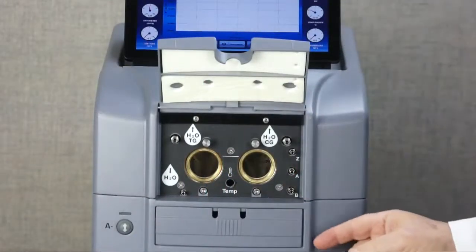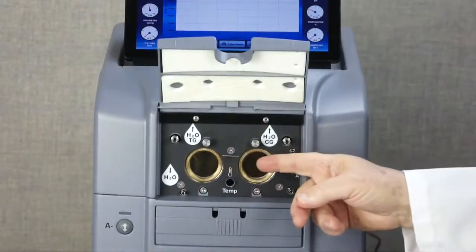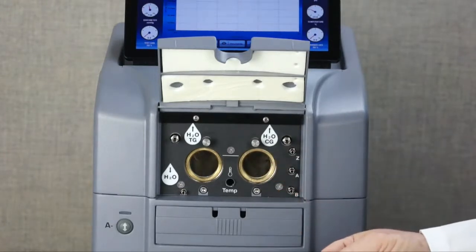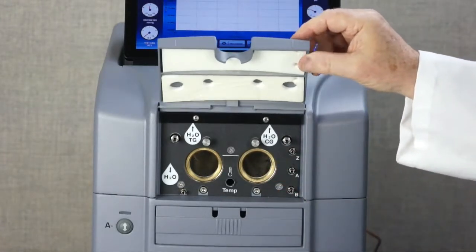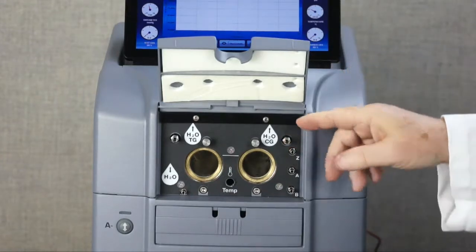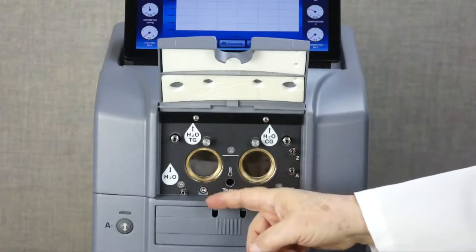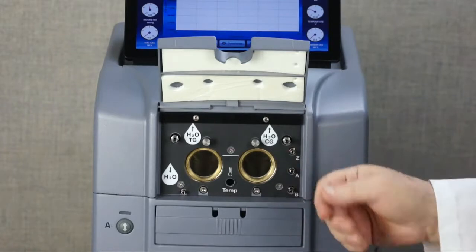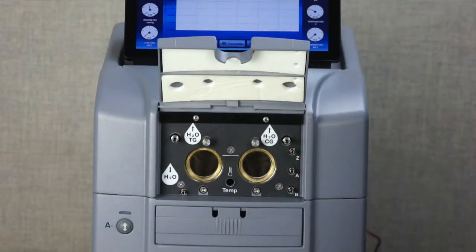We have added almost 4 times the amount of water that can be carried in the reservoir. Adding water is simple. Just lift the cover and inject water through this Luer lock fitting. For transportation, all water is easily removed through this one port. One time-saving feature of the system is that it will display a warning on the touchscreen if you should set up a test with insufficient water in the reservoir. You can run RH testing over a weekend, confident that sufficient water will be available.